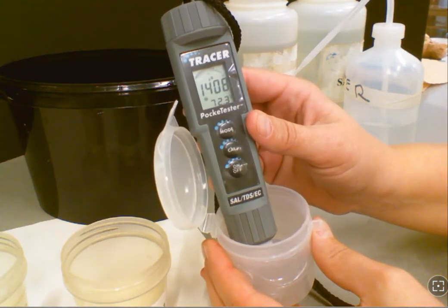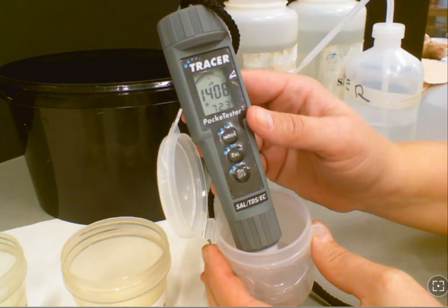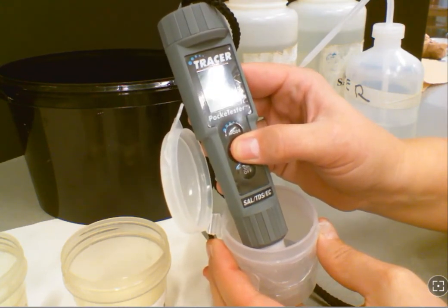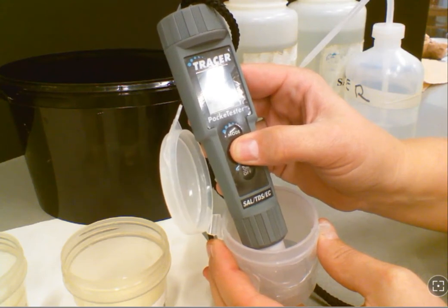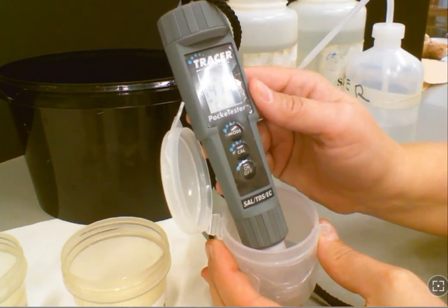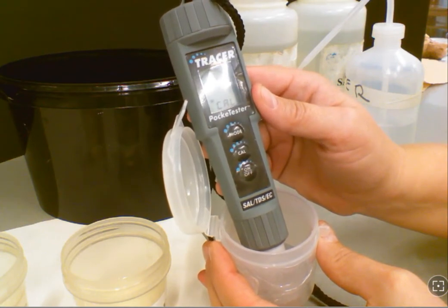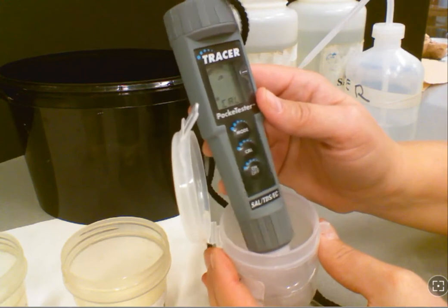Now we're going to need to calibrate. It should be 1413, but it's not reading that. So you have your probe in your calibration solution, and you're going to go ahead and click the calibration button. Once you do that, you can see it's blinking the correct measurement. Now you're calibrated and ready to do your testing.